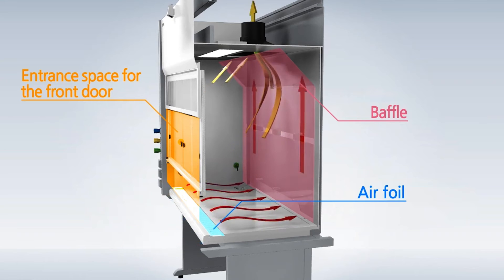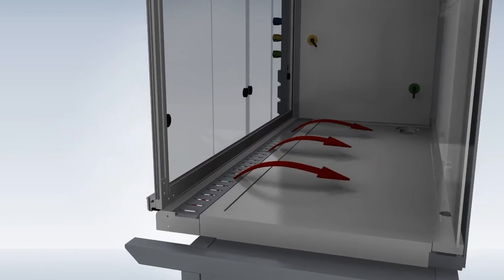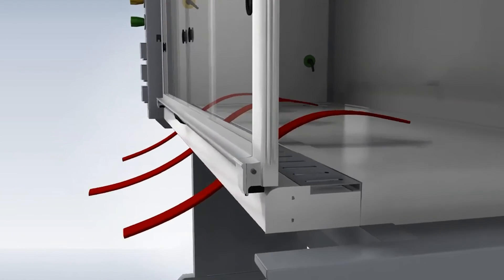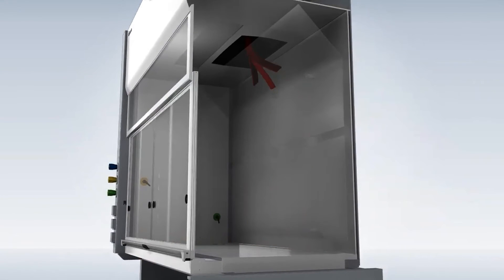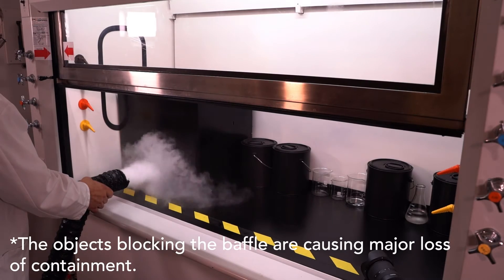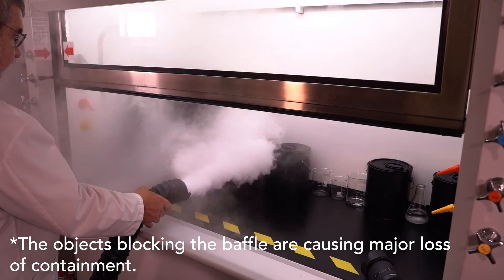Let's say that everything is balanced and working properly — there's air entering the fume chamber through the sash and over and under the lower airfoil. Given the pressure difference, the air is trying to flow across the work surface to the lower slot in the baffle, but if there are objects directly on the work surface or in front of the baffles, you disrupt that airflow.